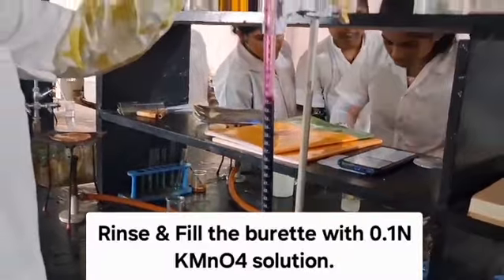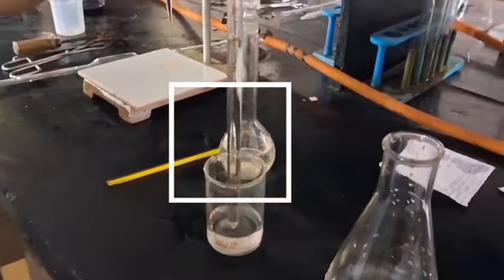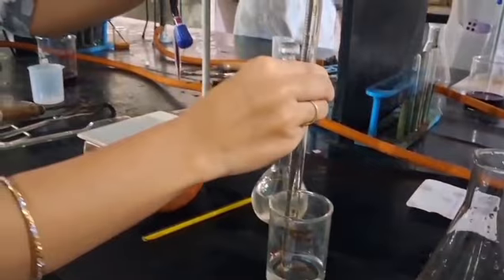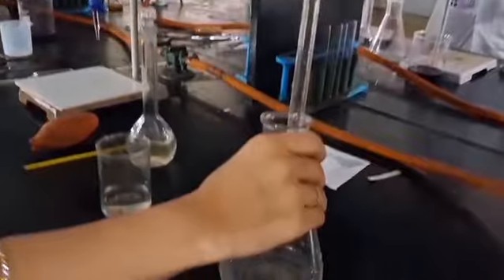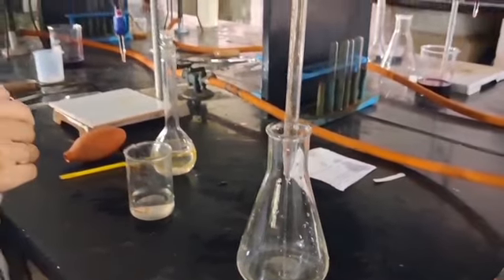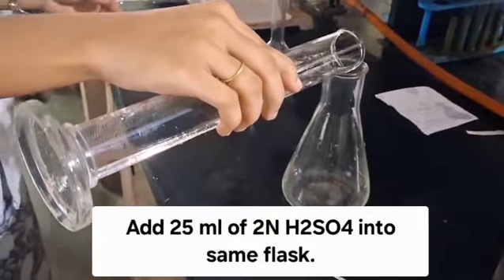Rinse and fill the burette with 0.1 normal KMnO4 solution. Adjust the zero level. Now transfer the 0.1 normal sodium oxalate into a 100 ml beaker and pipette out 10 cm³ of it into a 250 ml conical flask. Now measure 25 ml of 2 normal H2SO4 and add it into the same flask.